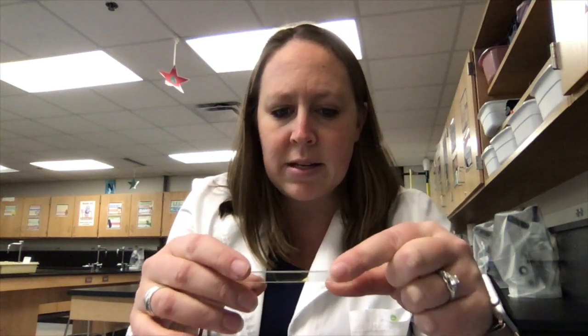So I'm going to go ahead and put one drop of that iodine here on my slide. And just like we did with the pond water, I'm going to take a cover slip and put that on top so that it kind of smooshes it out and makes it all nice and flat. And now I have a whole bunch of Mrs. C cheek cells here on my slide ready to go look at underneath the microscope.